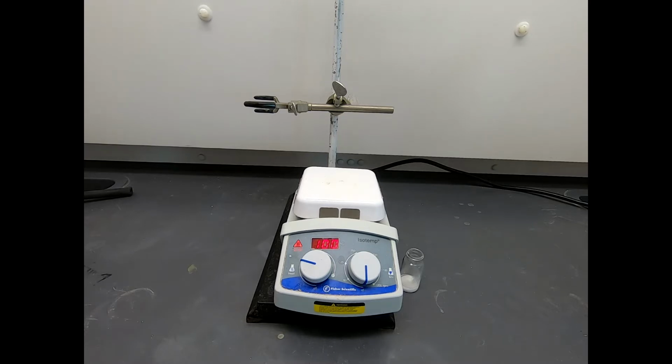And I think that burn is really because it's exothermically breaking down the fats in your skin. It is tough stuff, and because it's so thick, it doesn't rinse off as quickly. So it's got a little holding power on your skin. And of course, I don't want to talk about what it'll do to your eyes. It's incredibly destructive stuff.